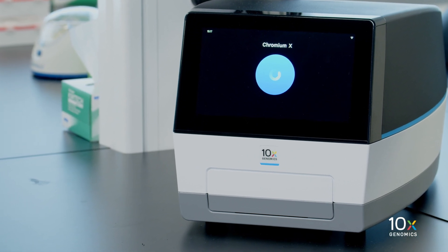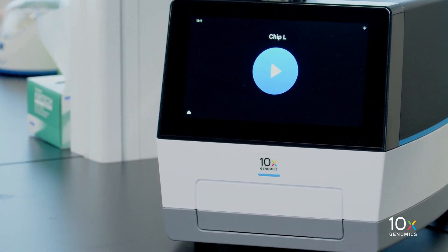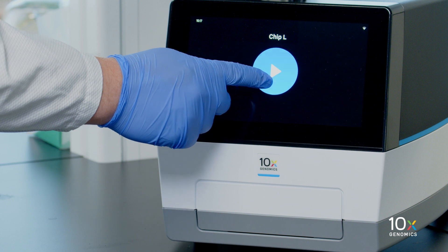We confirm that the Chromium instrument identifies the correct chip configuration. Then we initiate the run by pressing the play button.